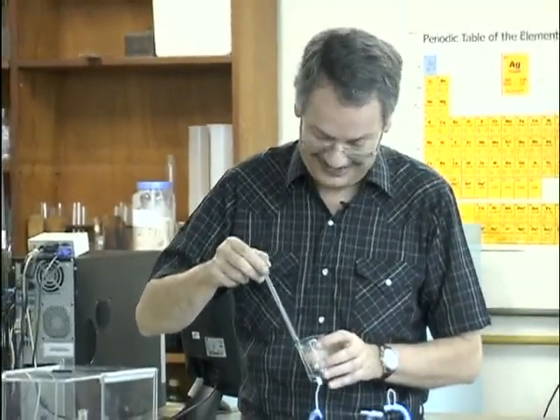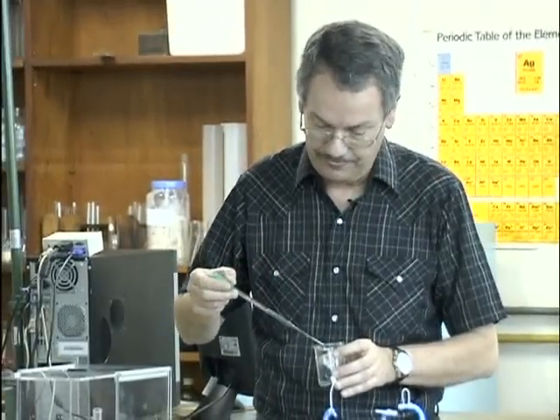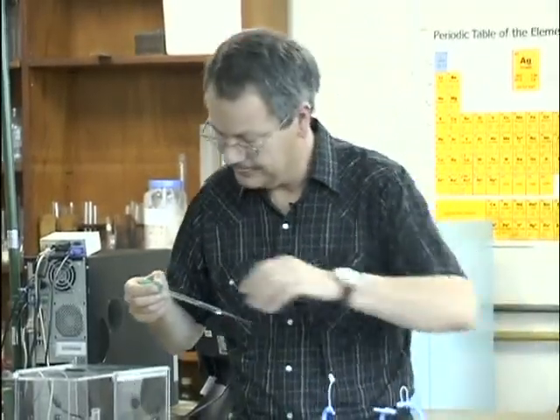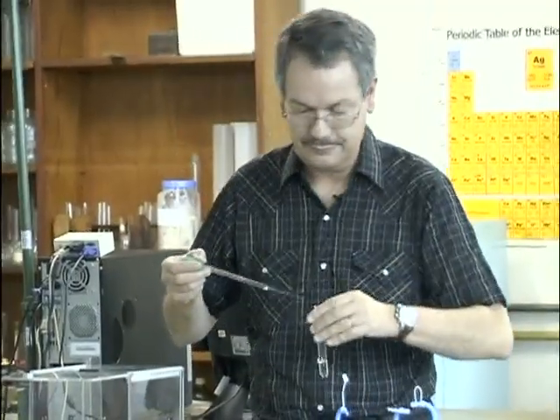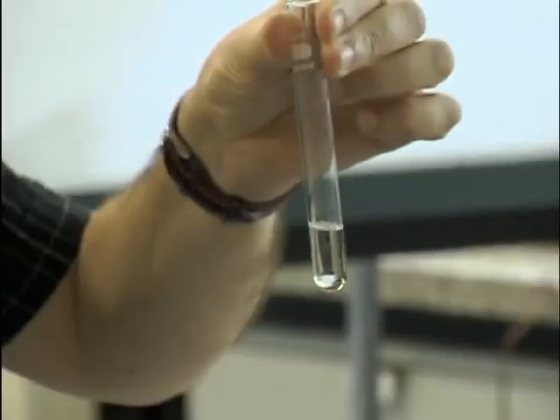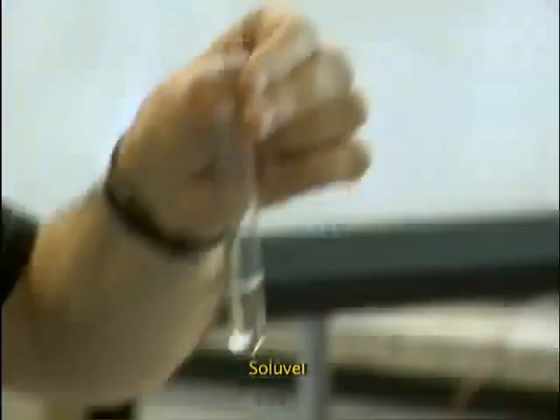I'm glad nobody got it. So 0. I put a drop. Soluble.